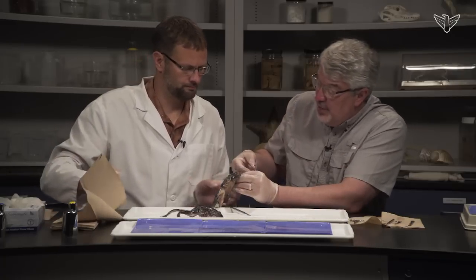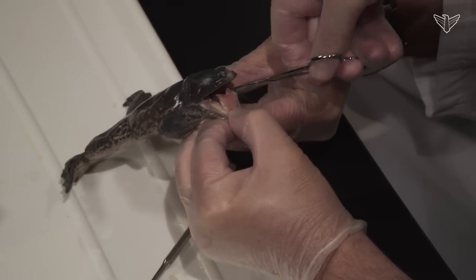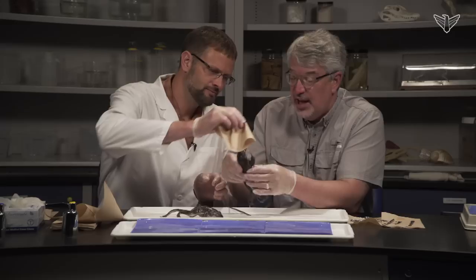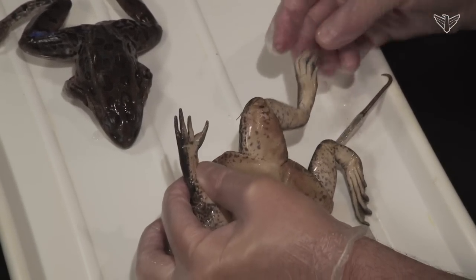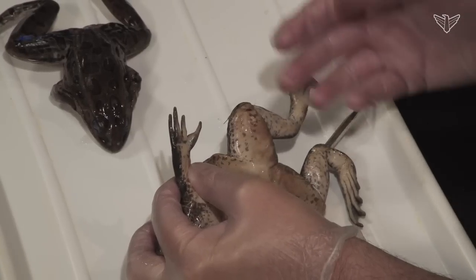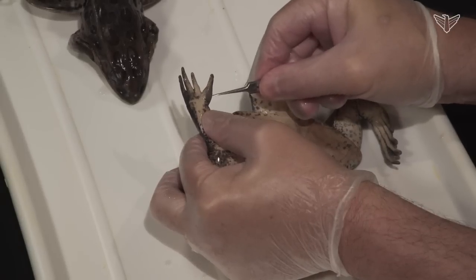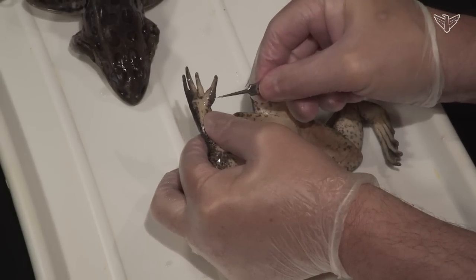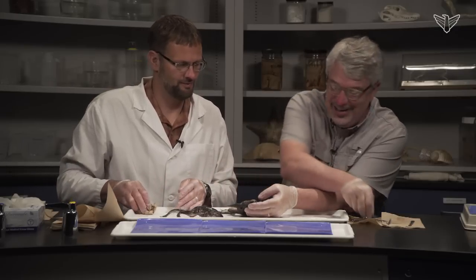Amphibians have four toes on their front foot and five toes on their back, whereas all the other tetrapods — reptiles, birds, mammals — have five on the front and five in the back. The males have a slightly swollen base of the thumb. You can see this structure right here, probably used for attaching to or holding on to the female during mating. So we'd assume this one is a male. Once you look internally, of course, you can tell definitively.